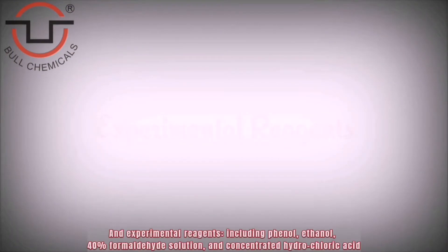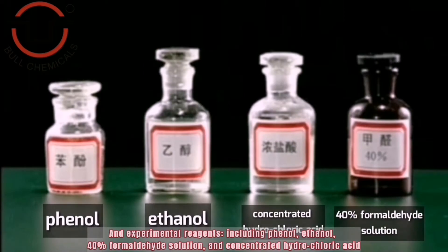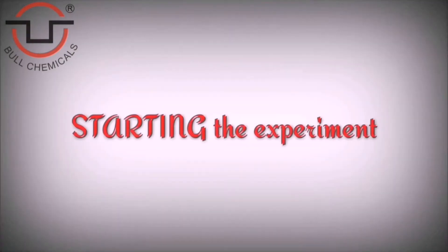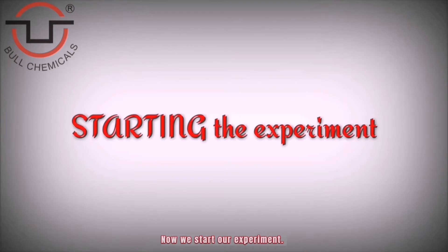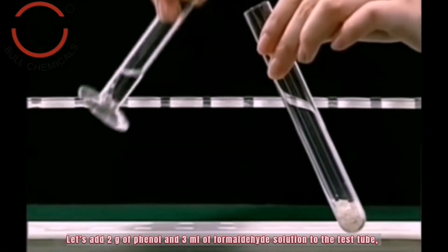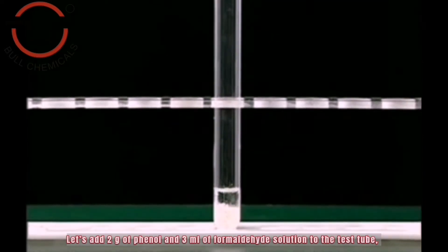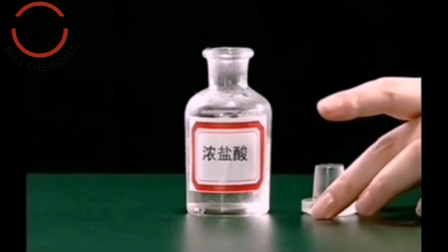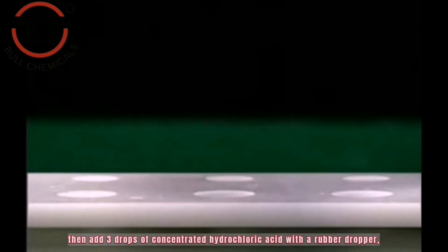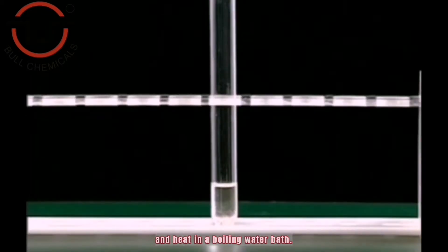And experimental reagents, including phenol, ethanol, 40% formaldehyde solution, and concentrated hydrochloric acid. Now we start our experiment. Let's add 2 grams of phenol and 3 milliliters of formaldehyde solution to the test tube, then add 3 drops of concentrated hydrochloric acid with a rubber dropper, and heat in a boiling water bath.